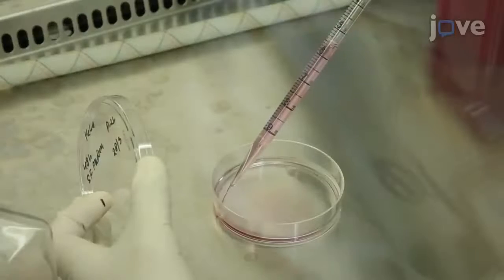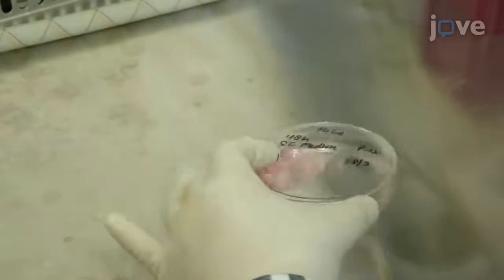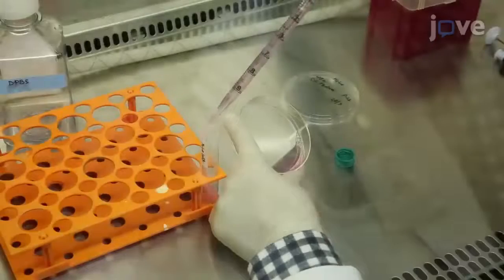When the cells have detached, stop the reaction with 5 mL of complete medium and transfer the cell solution into a 15 mL conical tube.